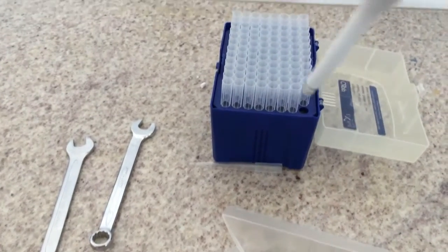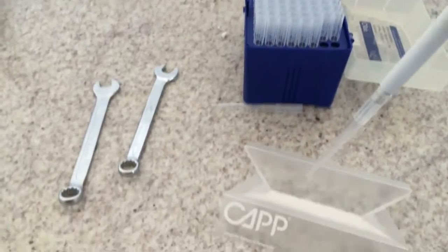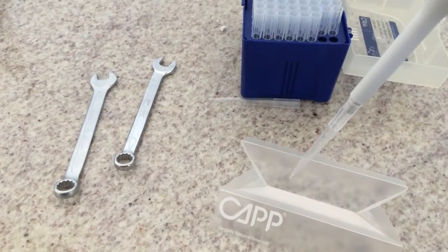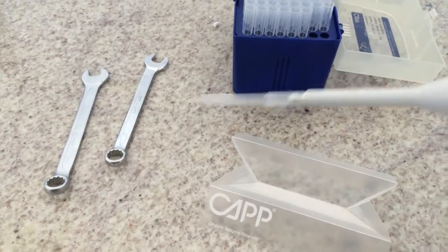discard it, mount a new tip, pre-wet it once, and then you can start pipetting with good expectations of accuracy and precision.